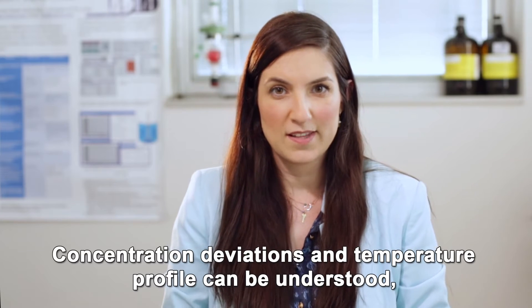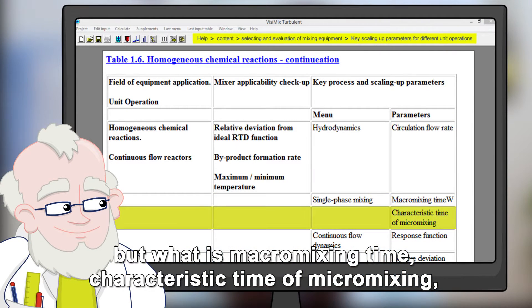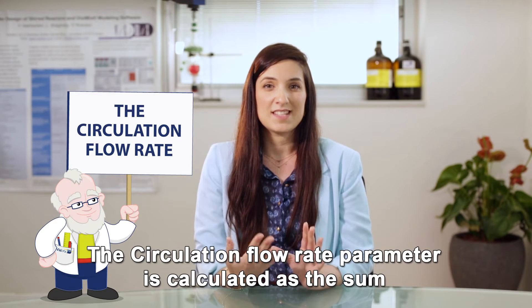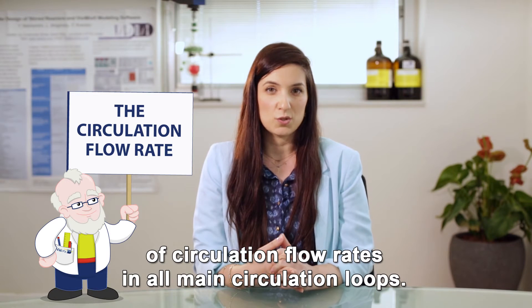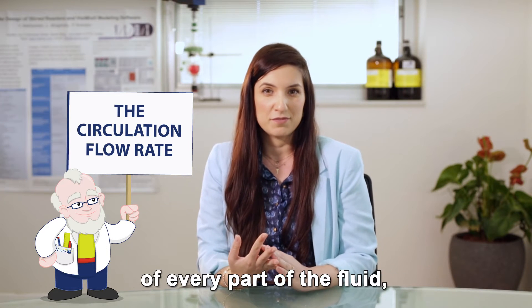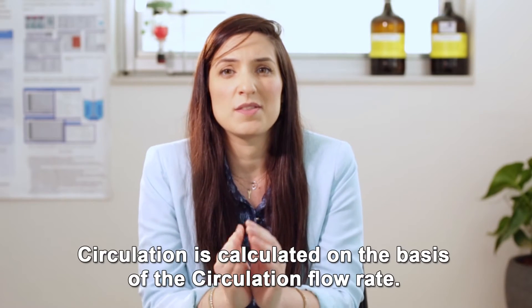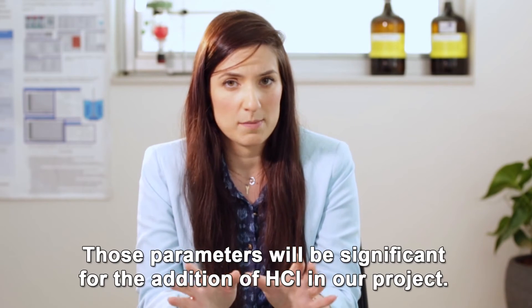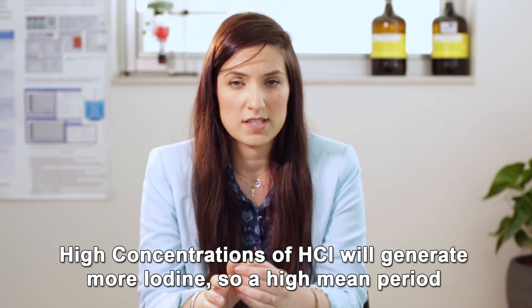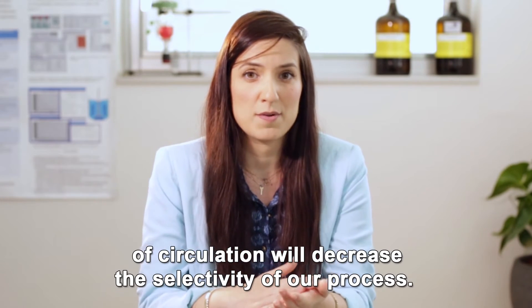Concentration deviations and temperature profile can be understood, but what is macromixing time, characteristic time of micromixing, circulation flow rate? The circulation flow rate parameter is calculated as the sum of circulation flow rates in all the main circulation loops. In practical terms, if the circulation flow rate represents the flow of every part of the fluid, the mean period of circulation is the average time of a single cycle of media. Circulation is calculated on the basis of circulation flow rate. Those parameters will be significant for the addition of HCl in our project. High concentration of HCl will generate more iodine, so a high mean period of circulation will decrease the selectivity of our process.